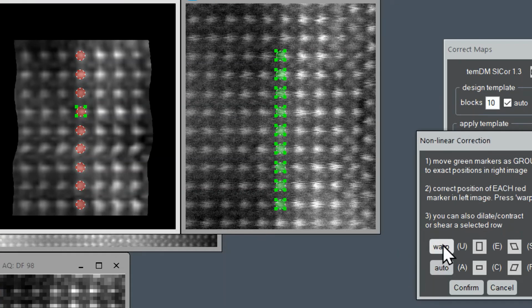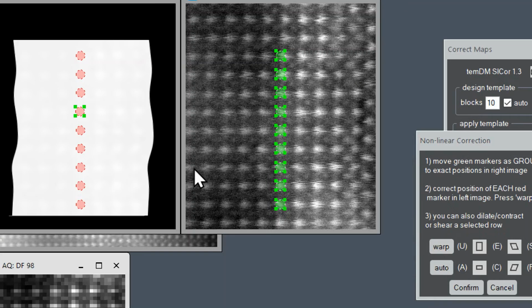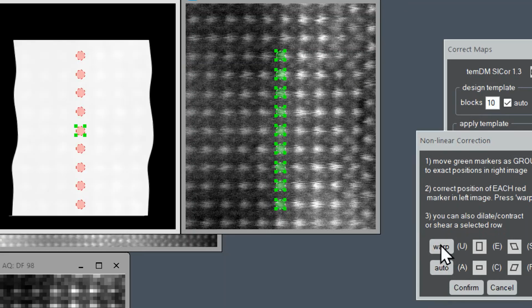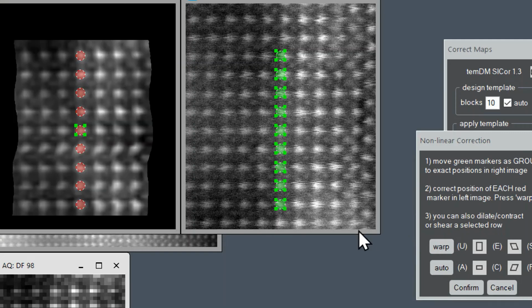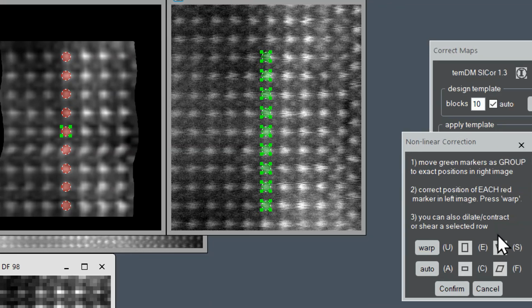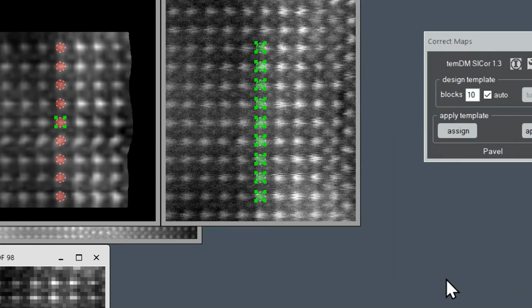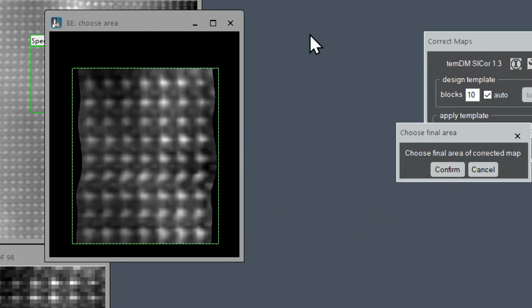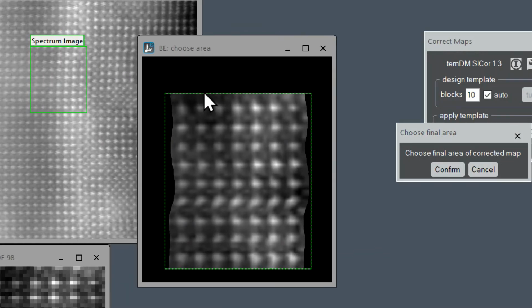But what is important? At the end, when you are more or less satisfied with the results of manual tuning, you are recommended to press the button auto. Then there would be automatic correlation of the left image and the right reference image, which is the most objective result.